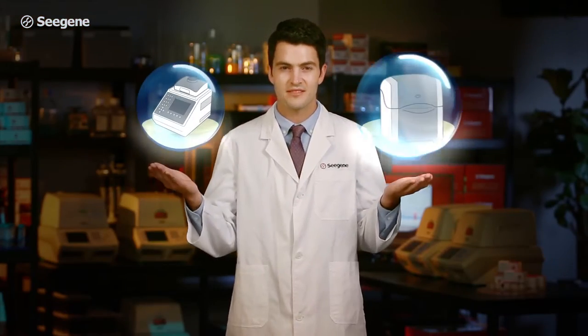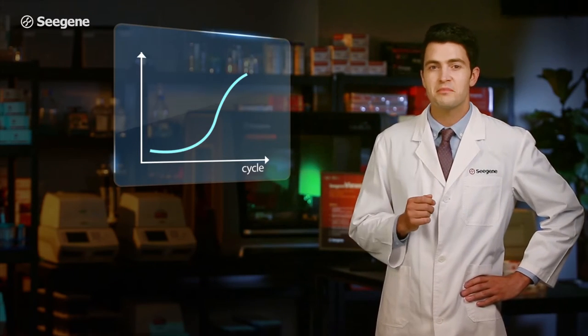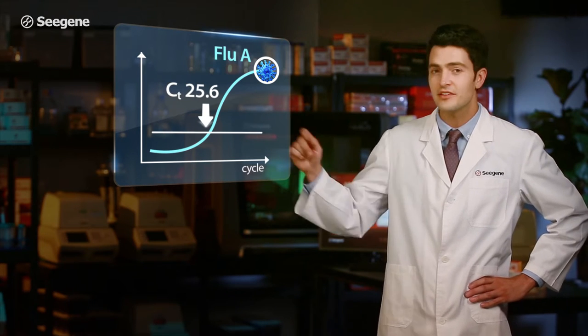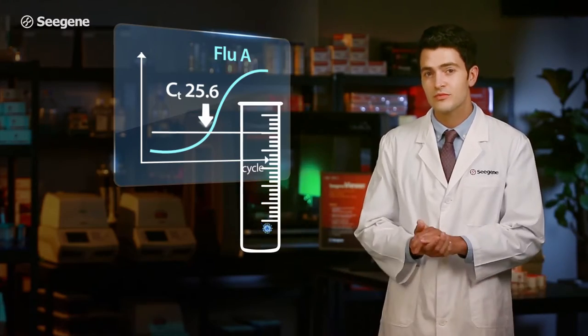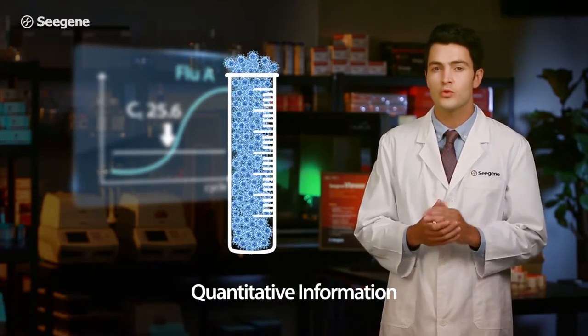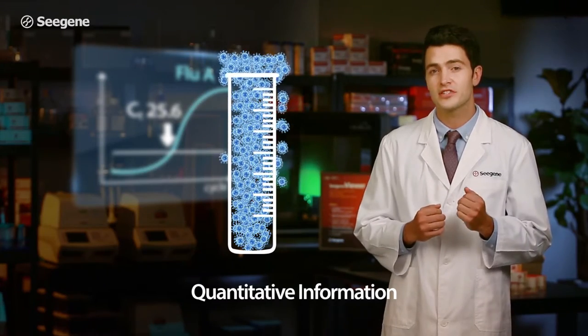Over the past decade, real-time PCR instruments have been developed for users' convenience and better performance in mind. A real-time PCR instrument measures a target's CT value by using a fluorescent signal. This CT value can be used to quantitatively detect the presence of an infectious agent.